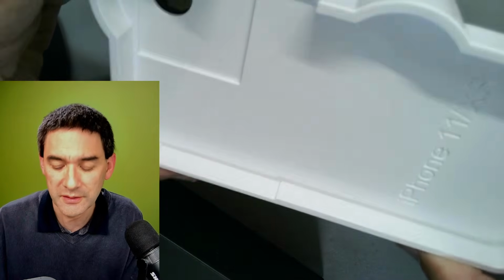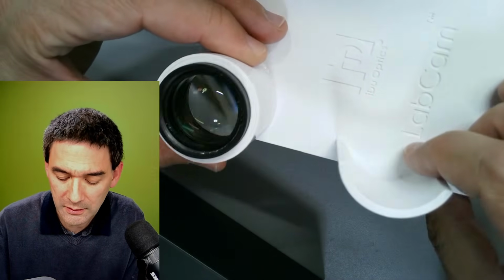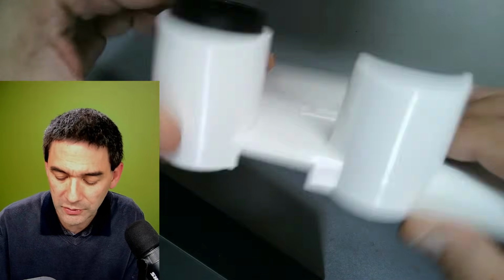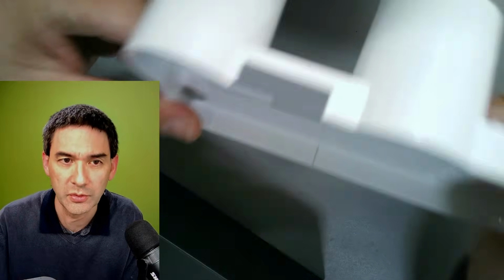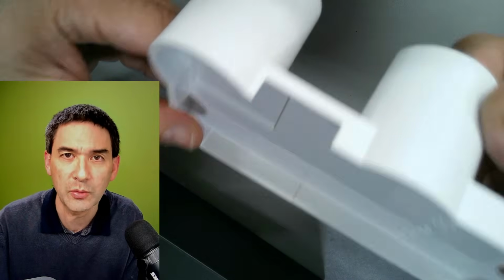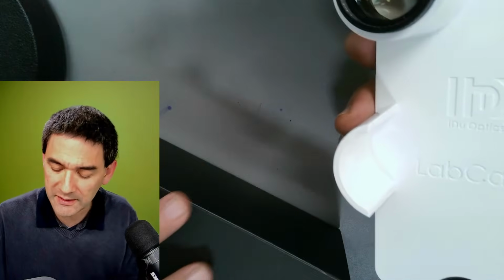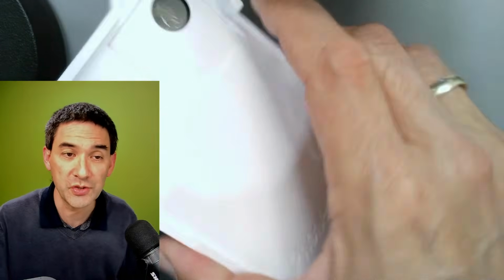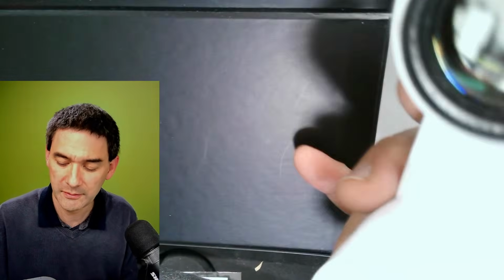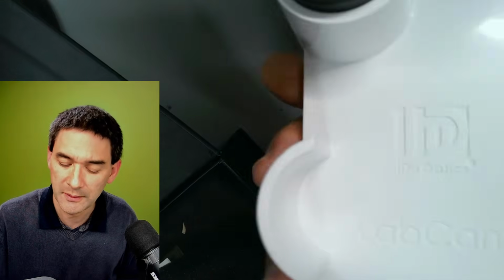Okay, so that's actually a nice idea, really. To have a system where you are able to hold this horizontally, but this also adds quite a bit of stability to the whole thing. However, the last time I checked, this was not a cheap adapter. Okay, but it should be easy to 3D print.